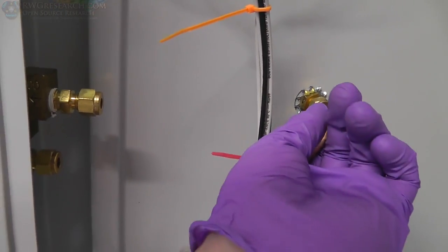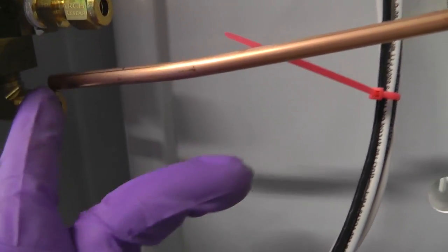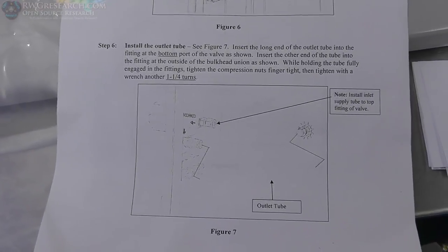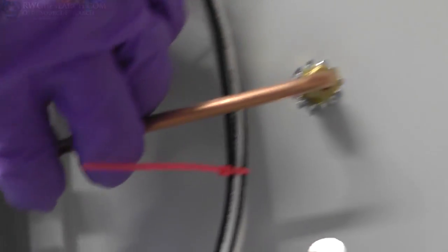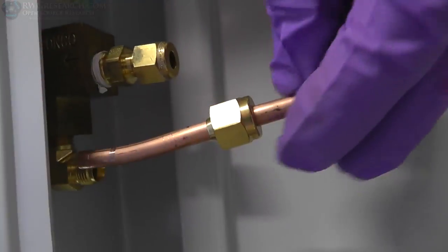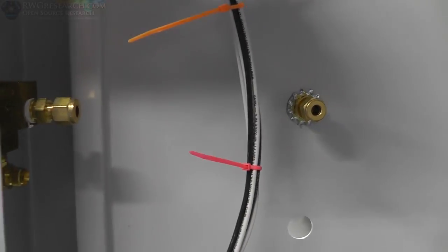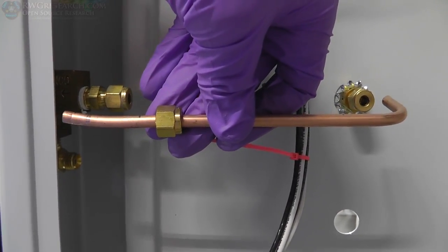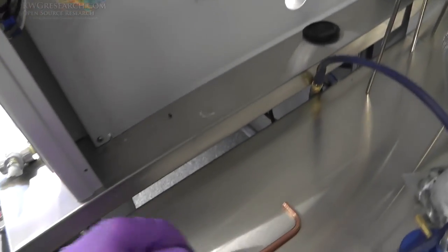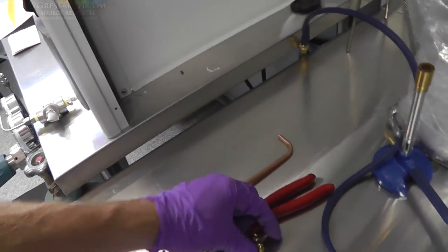So if I put it in here, you can see I have to really do some finagling. So I'm going to rebend this slightly just enough to make sure it's in here far enough, but I don't know. I'm following directions specified exactly as they say. Okay. Well, if I put it in here like they specify, the pipe is not long enough. So I'm going to have to rebend this corner, make it a little longer. I've already straightened it, so it's as best as it can be. But it's kind of silly. For as much money as this costs, this should just fit. Oh well, I guess that's called... What is that called? I forgot what that's called. Let me think. Oh yeah, field modifications.